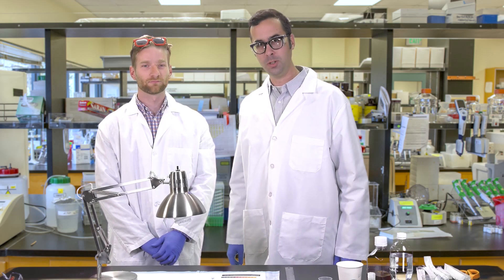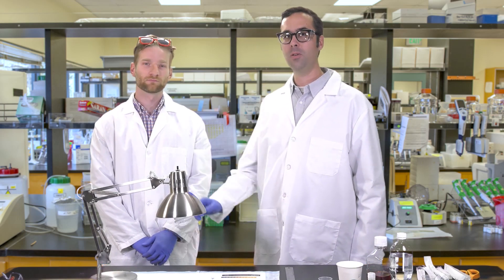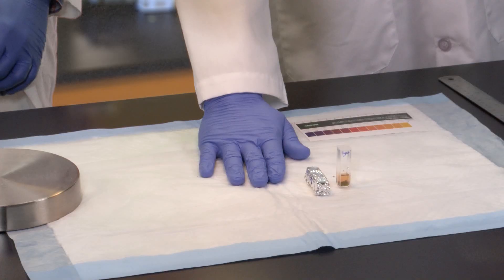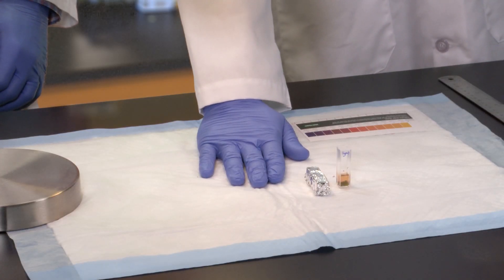One, the light source shouldn't be too hot or too bright or it will fry your algae beads. If you can feel any heat on the back of your hand, your lamp is too hot.